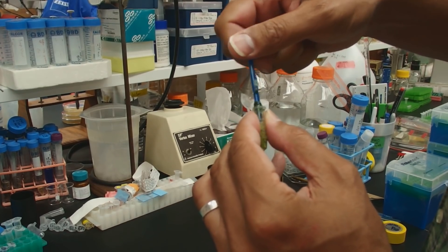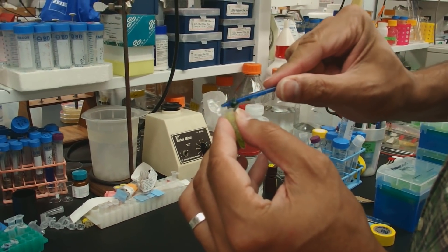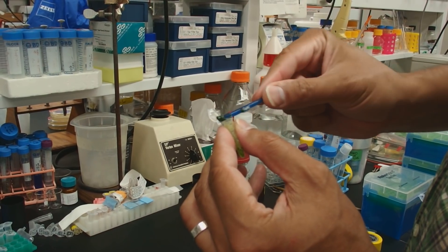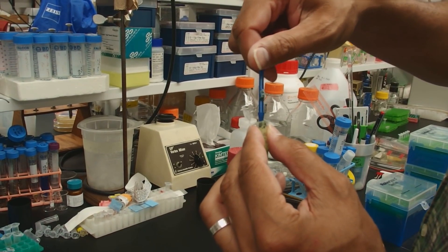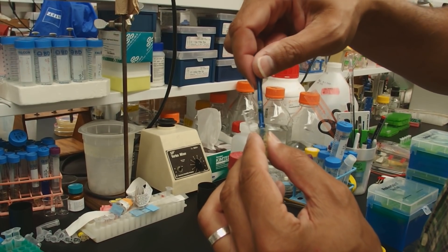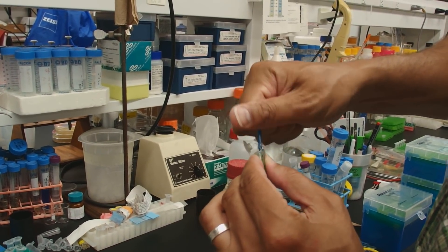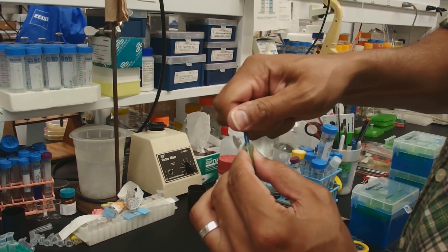The more you grind, the more DNA you'll get. And if you really want to get all the DNA that you can out of a tissue, like say it's precious, you would want to freeze this tissue in liquid nitrogen first, then grind it. It becomes very easy to get a really powdered plant material.